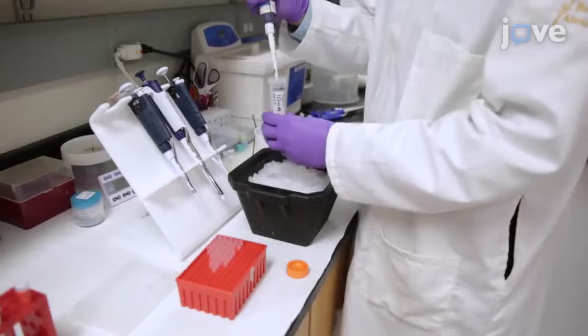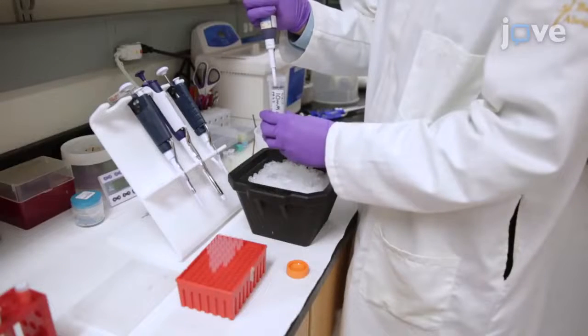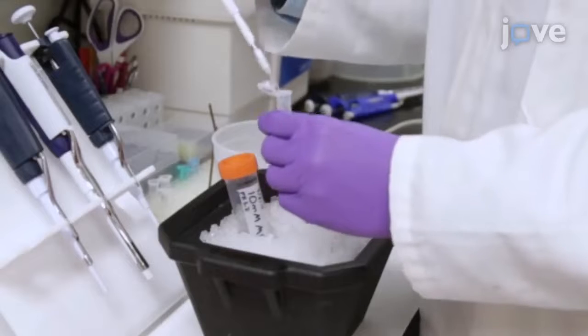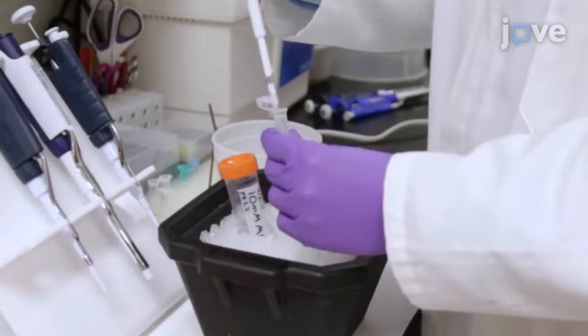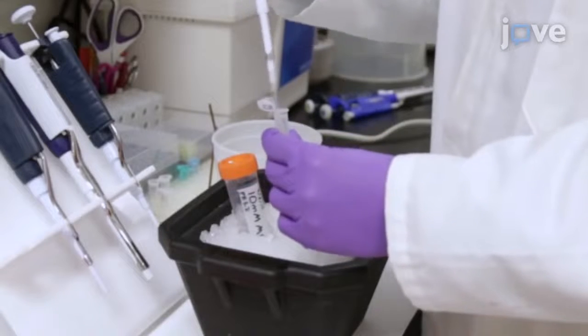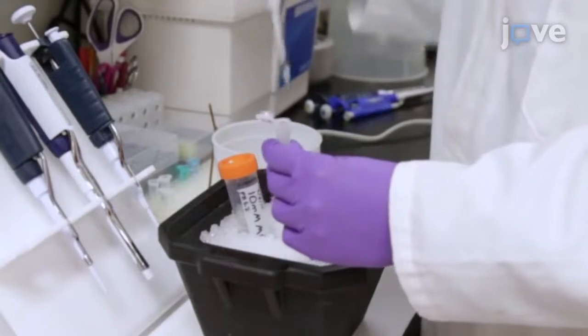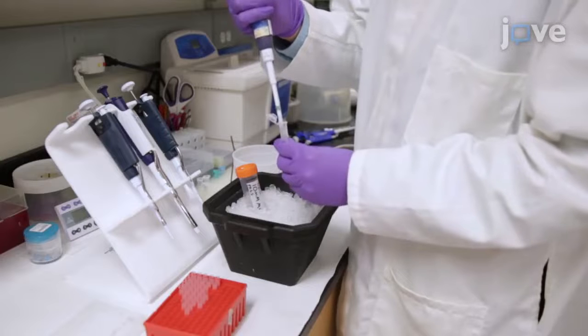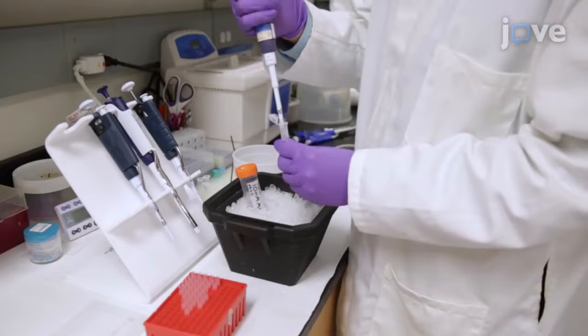Dilute the HEV nanoparticle samples to between 0.5 and 2 milligrams per milliliter with 10 millimolar MES, pH 6.2, for TEM imaging.